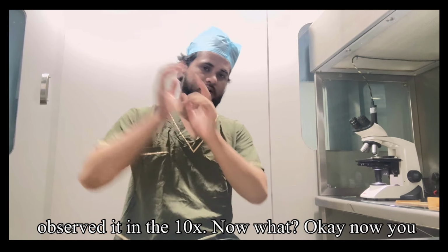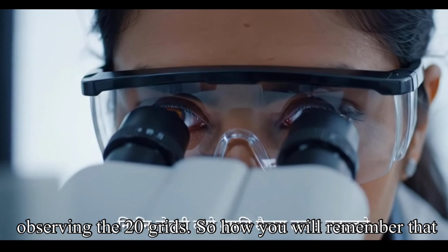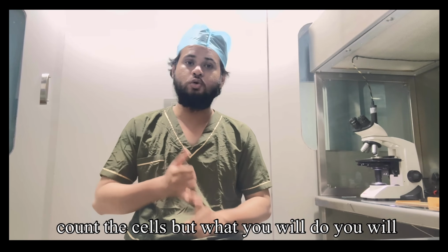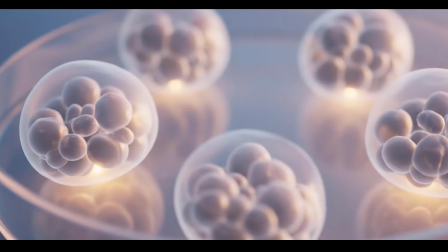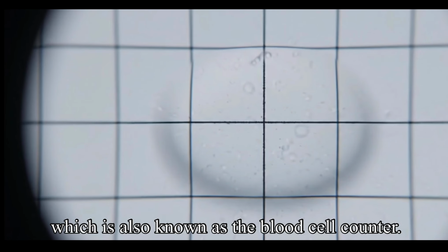Now, there are 100 grids, but you are considering 20 grids and observing those 20 grids. So how will you remember how many cells you have observed? You cannot count the cells by memory, so you will go for the sperm cell counter. For counting you need a sperm cell counter, which is also known as the blood cell counter.